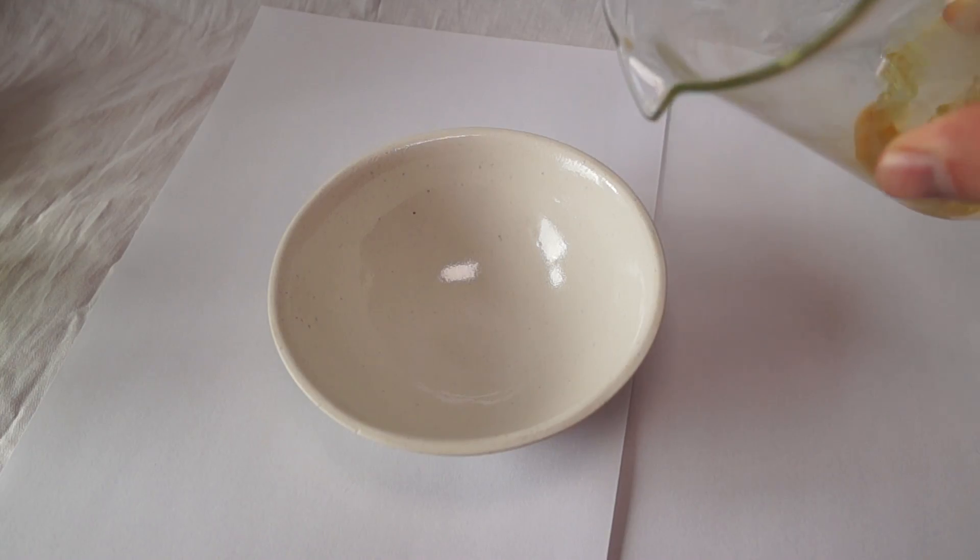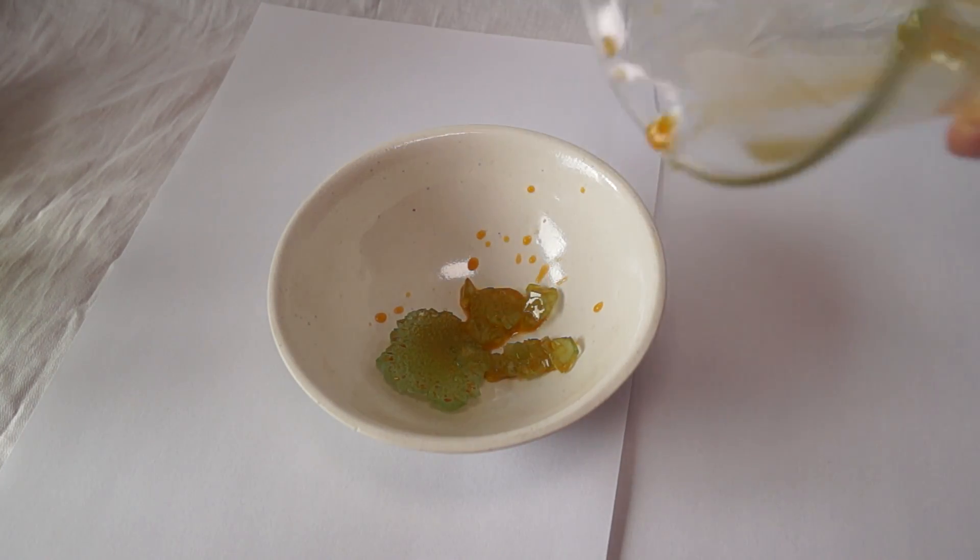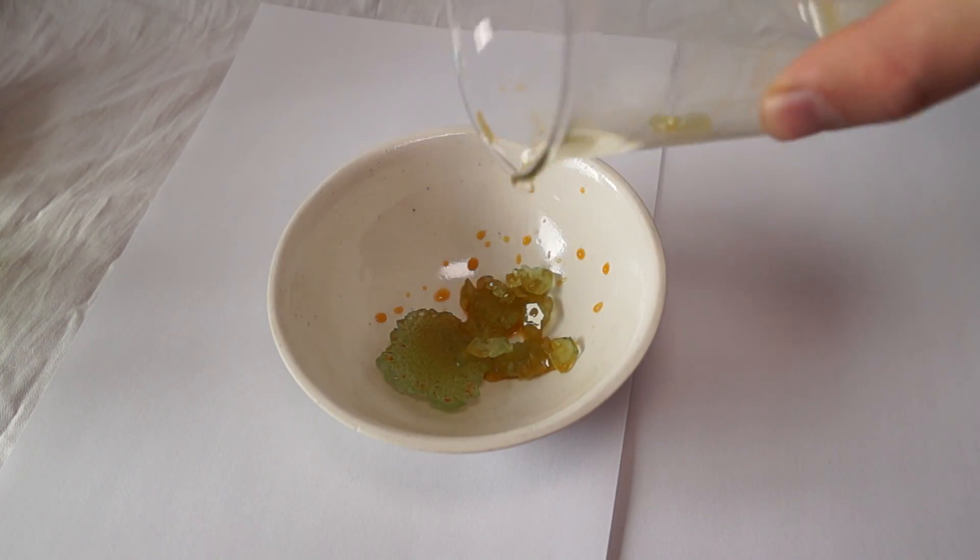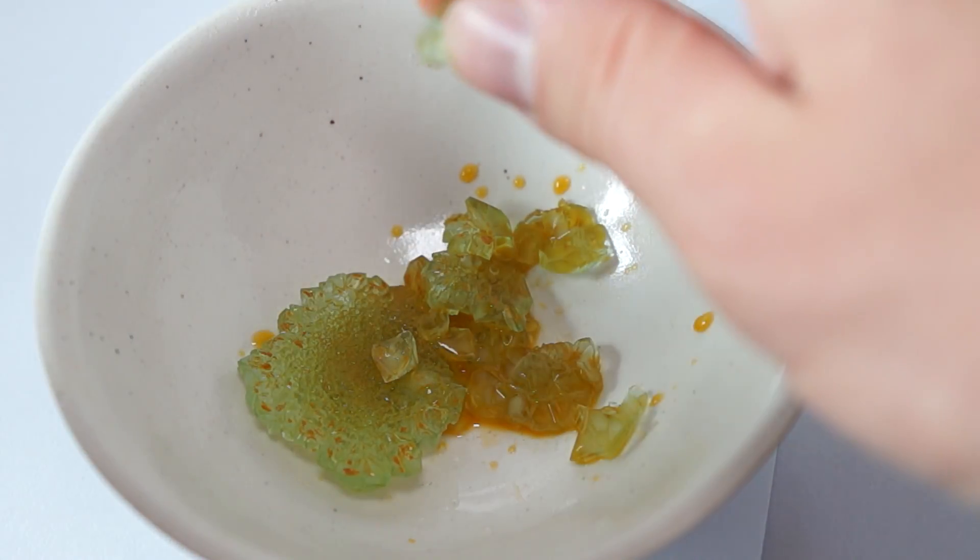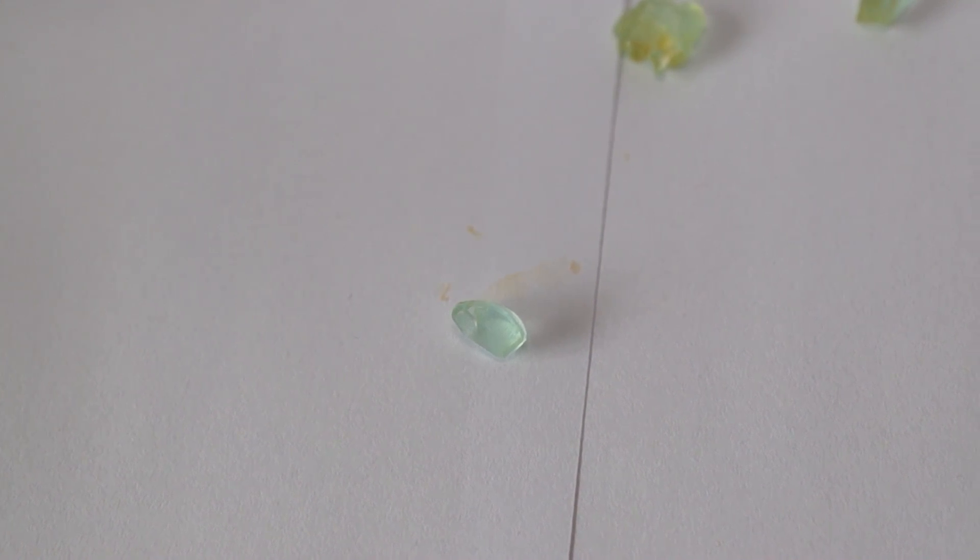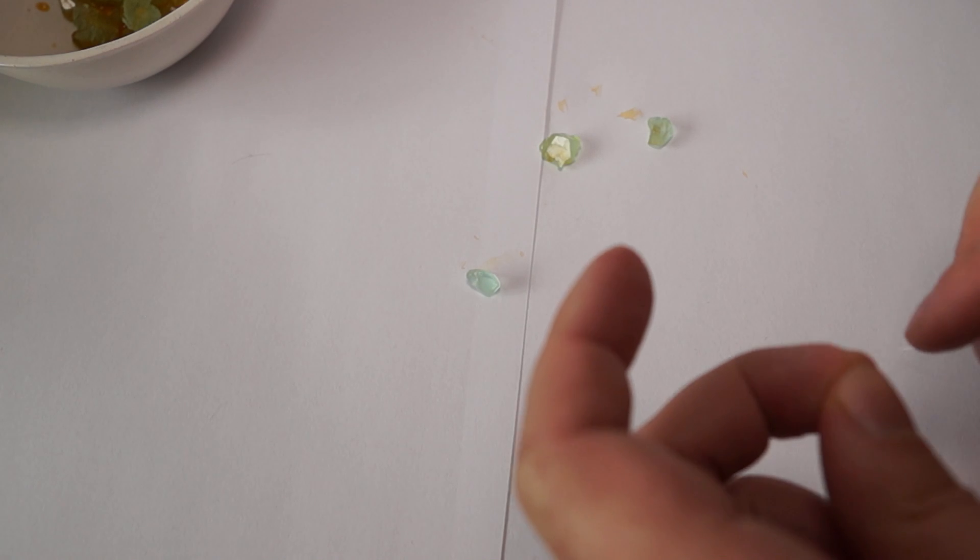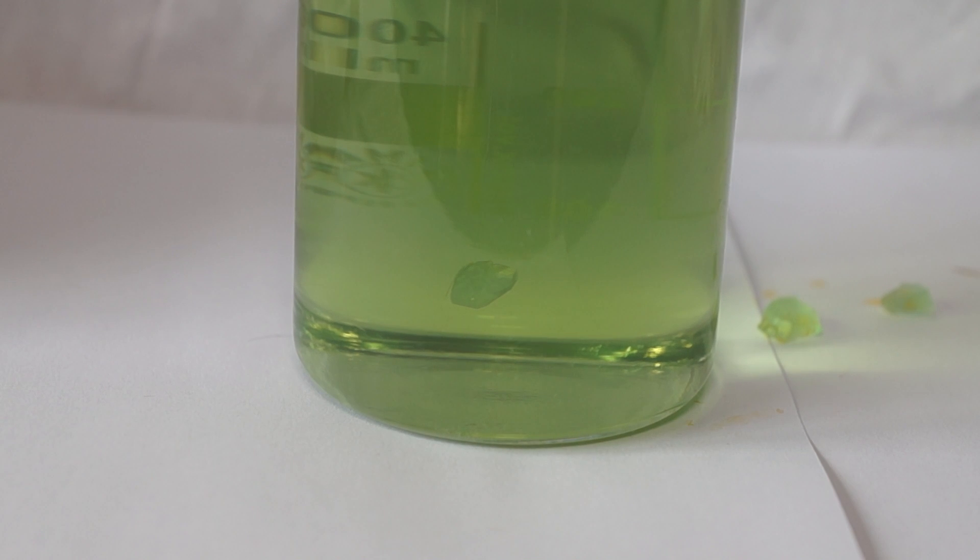Now you need to select a seed from the mixture of green crystals that have grown overnight at the bottom of the glass. The seed is a small crystal from which a large crystal will be able to grow in the future. The crystal seed must be of a regular shape and large enough. You must bind the seed to a thin fishing line and hang it in the filtered solution of Mohr's salt.